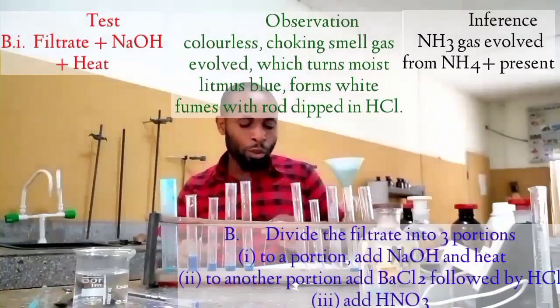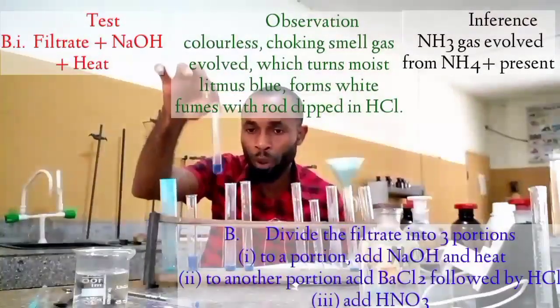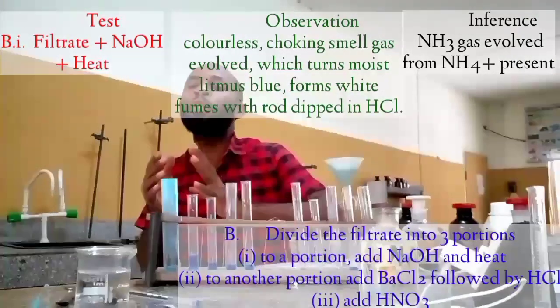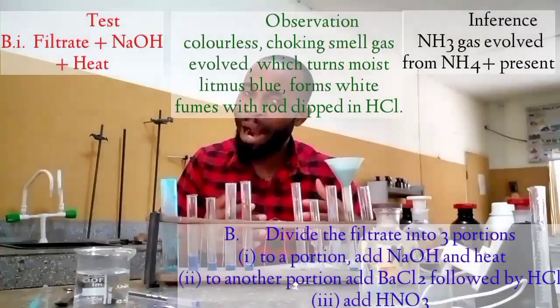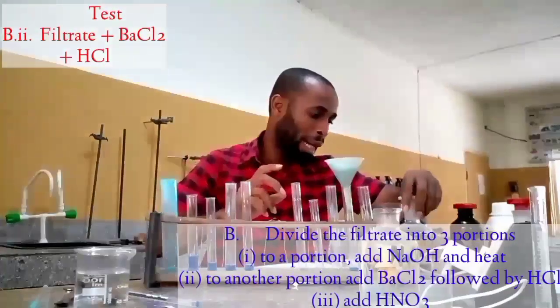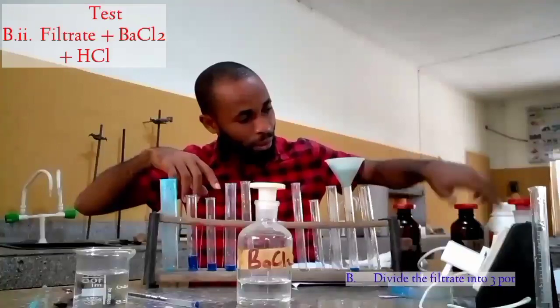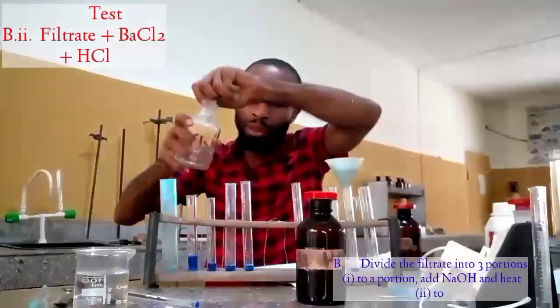The third statement goes like this: to the second portion, see the second portion here. What it asks us to do here is add barium chloride followed by either hydrochloric acid or trioxonitrate(V) acid. I'm going to use hydrochloric acid. This is barium chloride, and this is my hydrochloric acid. Now let's add to this.